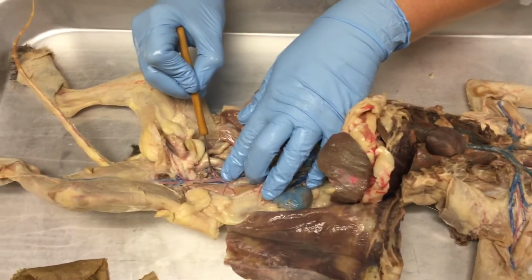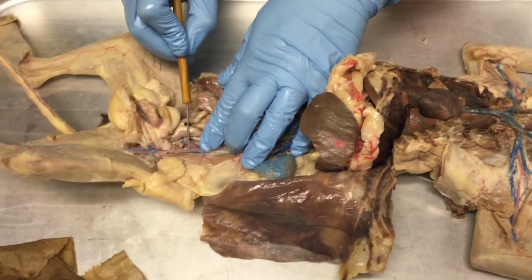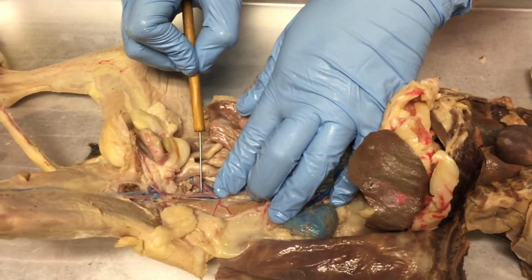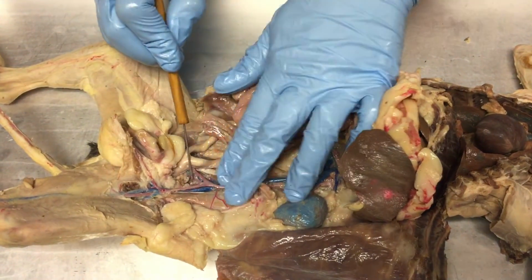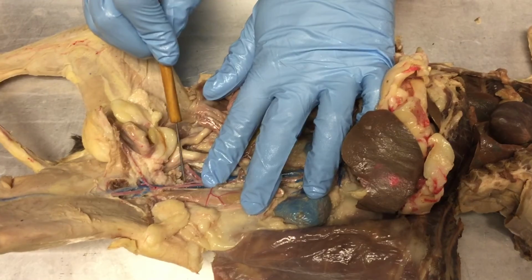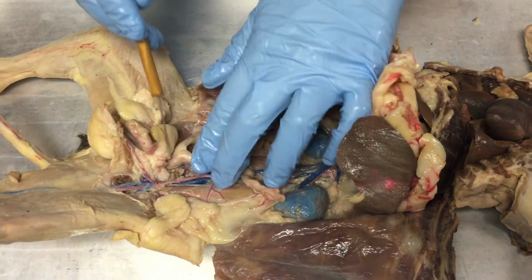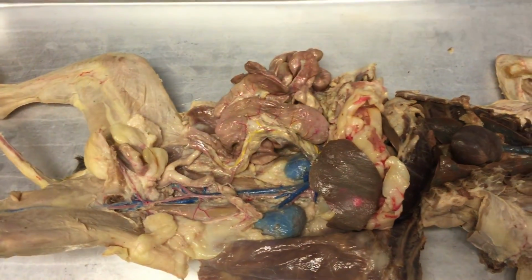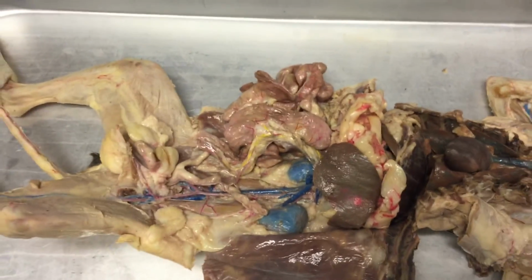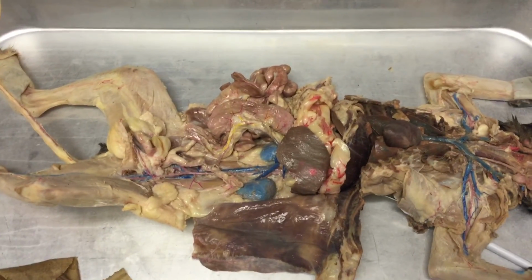Does everyone see this artery that comes and branches off the middle of the internal iliacs? This one that goes down, and it goes kind of down and back. That's the caudal artery. It's going to the tail. That's why it's going back. So this is the caudal artery. It supplies the tail with blood. So we don't have that. We have one, it's just not called caudal because it doesn't go to our tail. It's called the median sacral artery in humans.